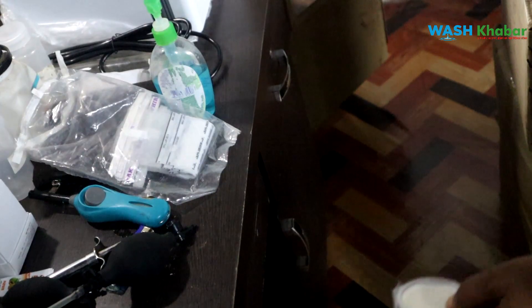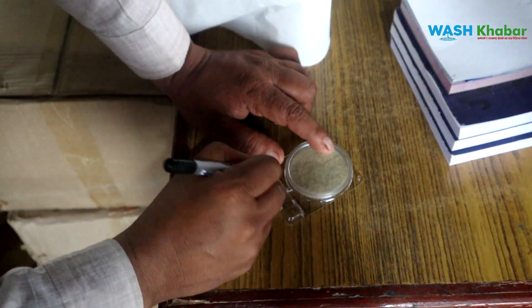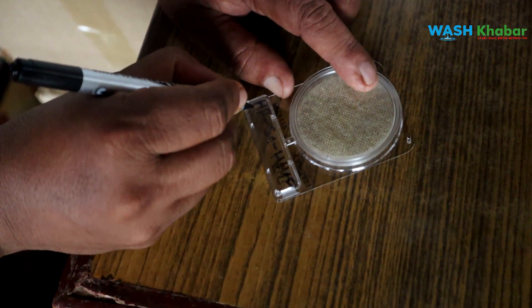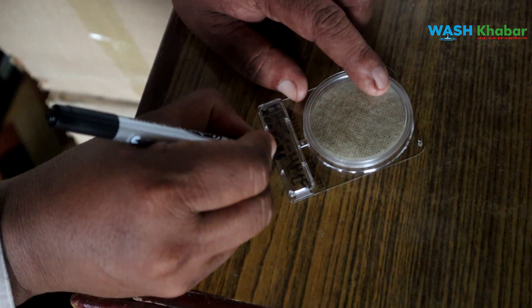This is the water. What is it? SP-2. 18, 15, 18, 28.